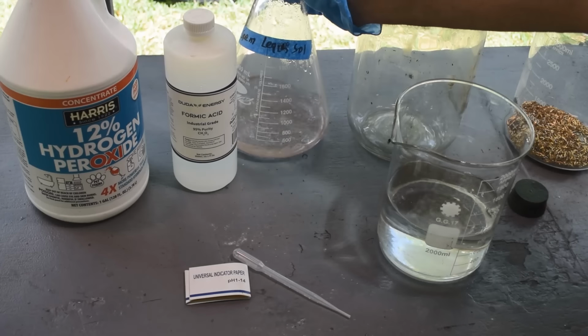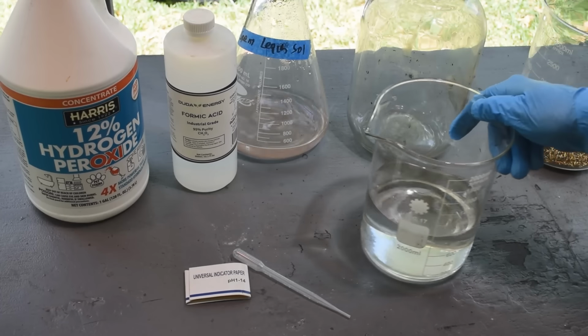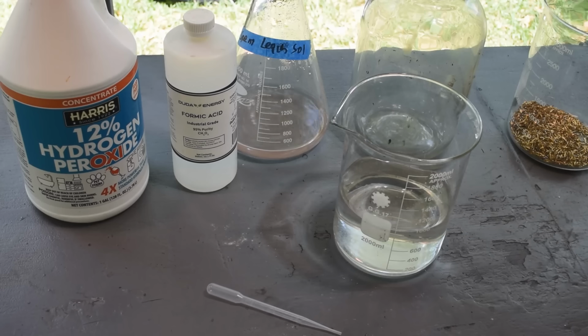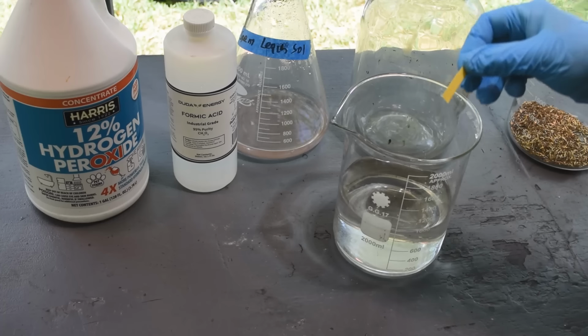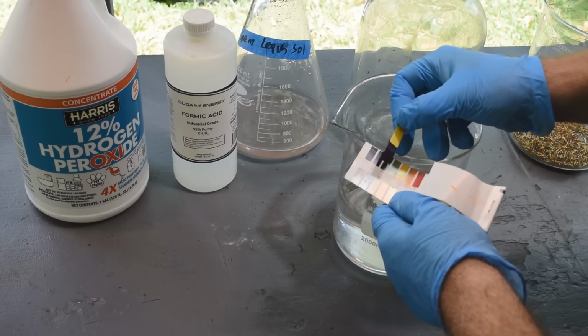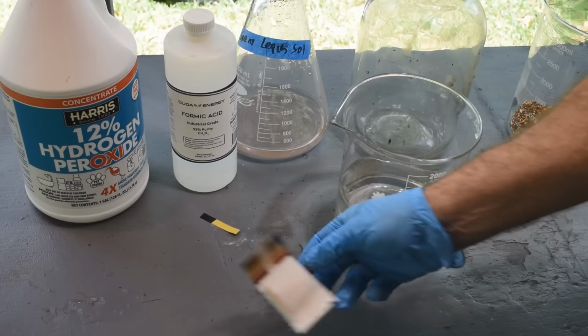So we'll get it if it is, but it really doesn't look like it is. All right, so we got a liter of the spent leach. This stuff should be very alkaline. Got my pH papers here. We'll take a look. Litmus, another word for it. Oh yeah, very alkaline. Up around 12. So yeah, we are very, very alkaline.